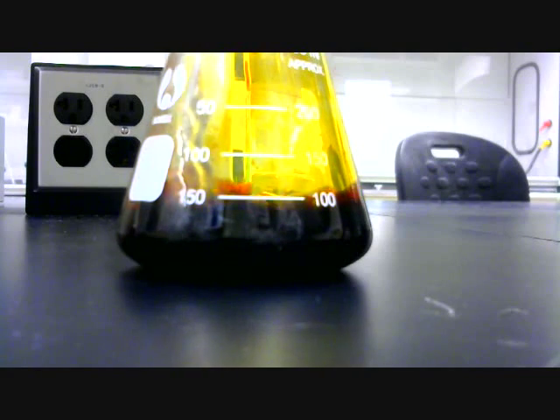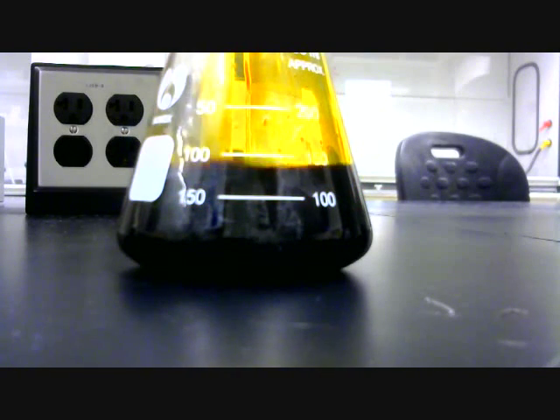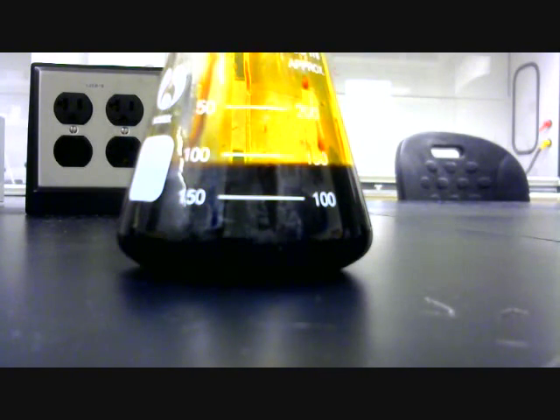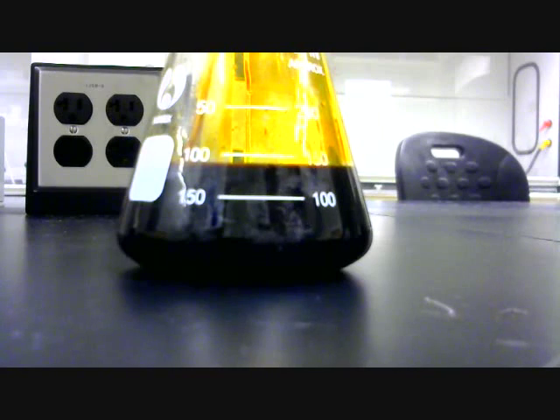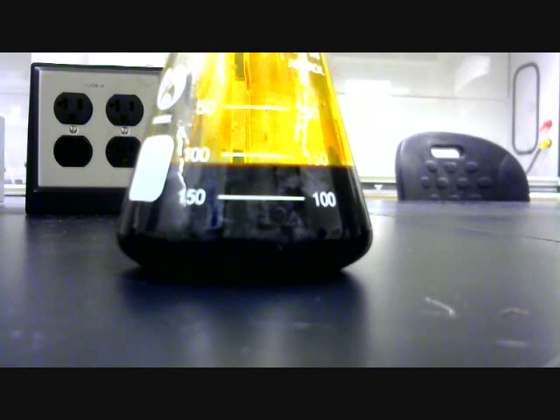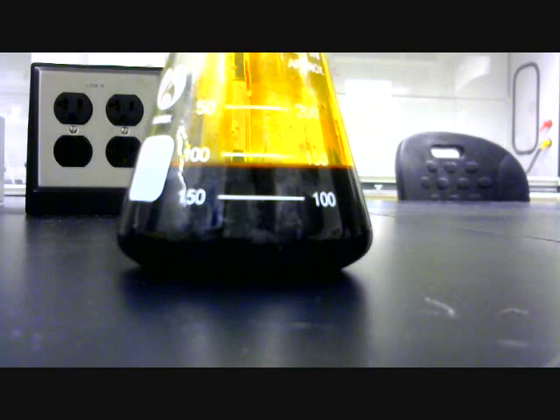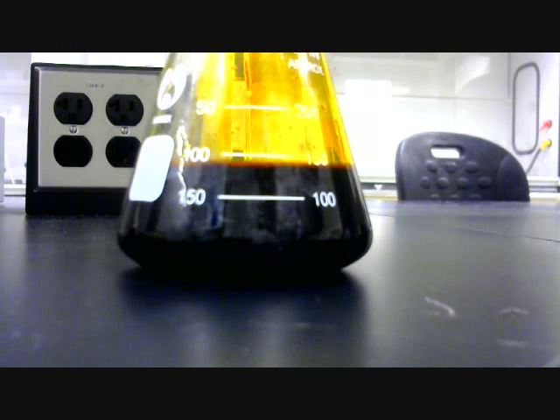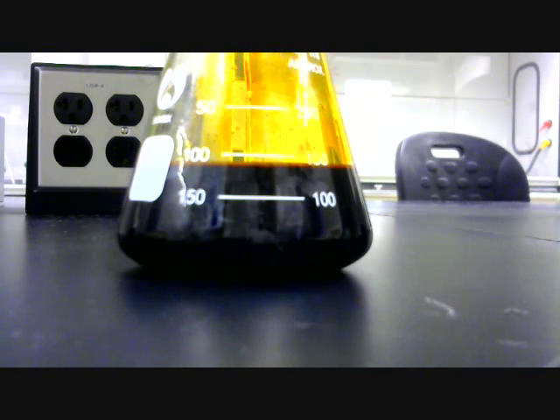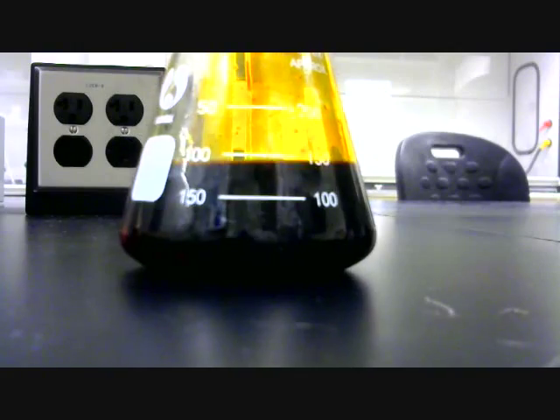Water is added. The product we care about for this reaction is not very soluble in water, so adding water helps it precipitate, whereas the other major products will be more soluble in water than acetone, keeping our products separate.